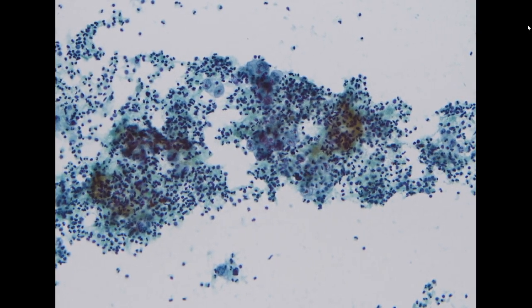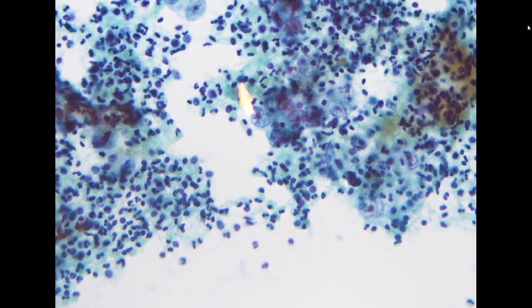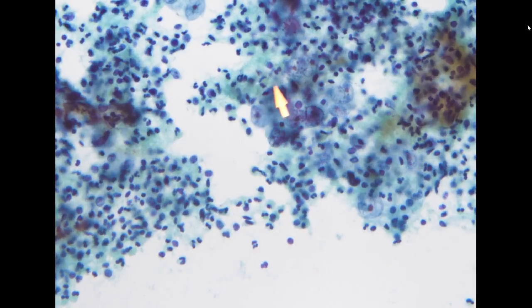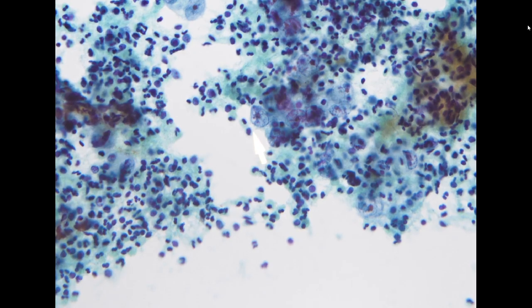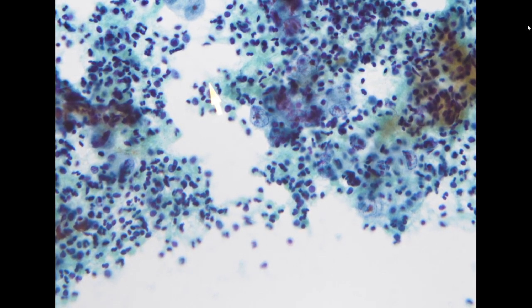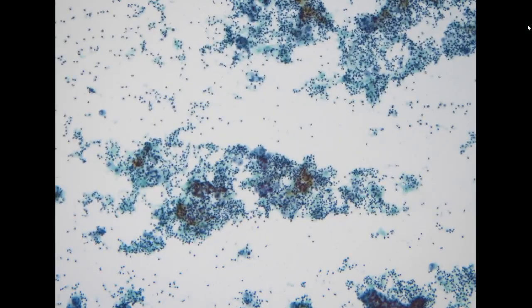So this shows much more inflammation, even some acute inflammation. You can see the malignant cell is actually hiding within the dense inflammatory cells. So this is the malignant cell, and you can still appreciate this is three-dimensional. This is vesicular chromatin, and you can appreciate this nucleus is even as big as the adjacent reactive lymphocyte. So this is adenocarcinoma, hiding in the inflammatory background, but still positive for adenocarcinoma.